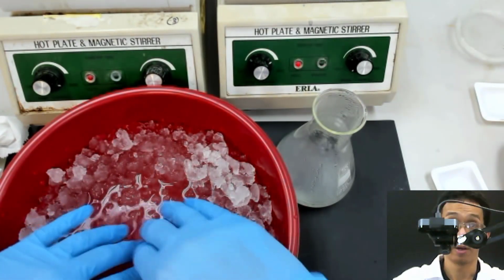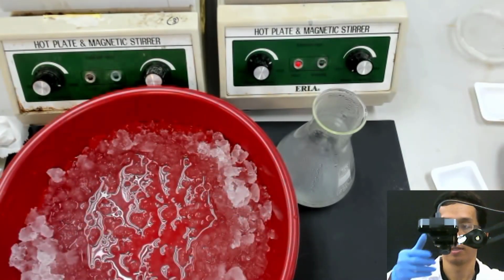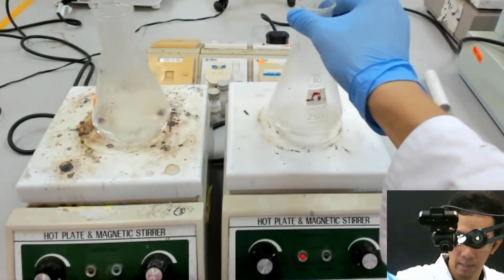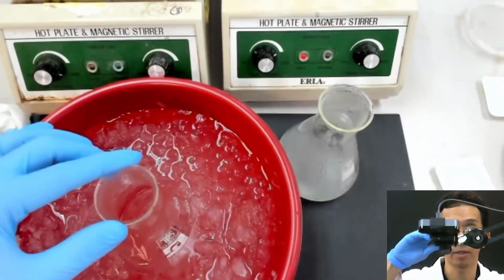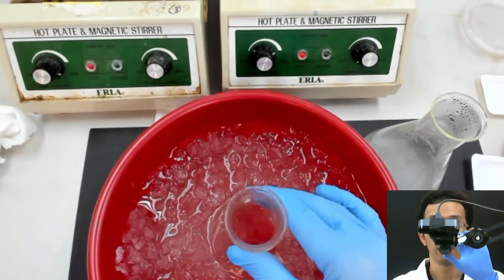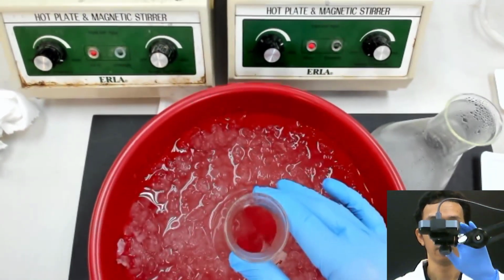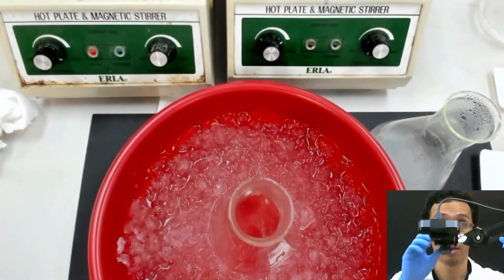Now I will put our sample inside. We will see the difference. What we do now is fast cooling. We call it fast cooling. I need to hold this, because if I don't hold it, it will move.